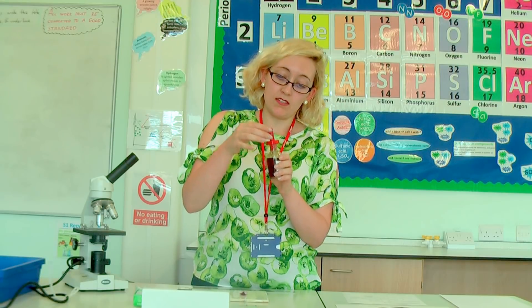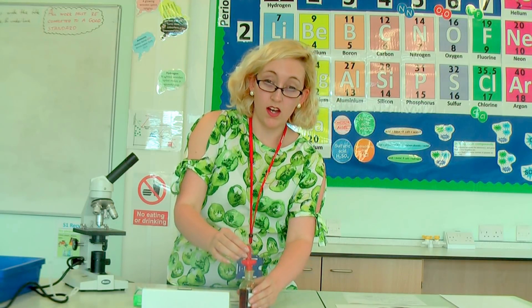I take my iodine — the iodine is just to stain it a little bit better so we can definitely see what we're doing when we put it on a microscope. Put a couple of drops on top; that will help me to see it.